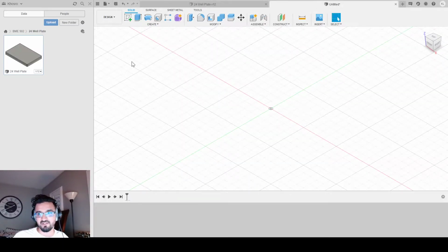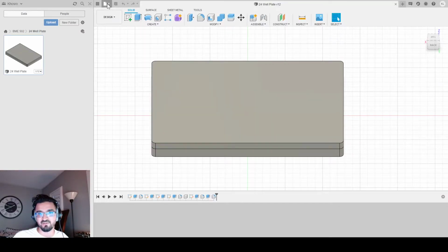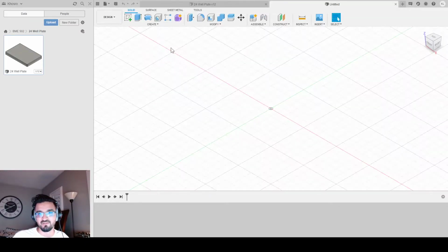So the first thing is to create a new project. I'm going to close this so I can create a new project, new design, so you can actually see step by step what I'm doing. Oh, and if I'm going too fast or anything, either slow down the playback speed or pause when you need to if you're following along.